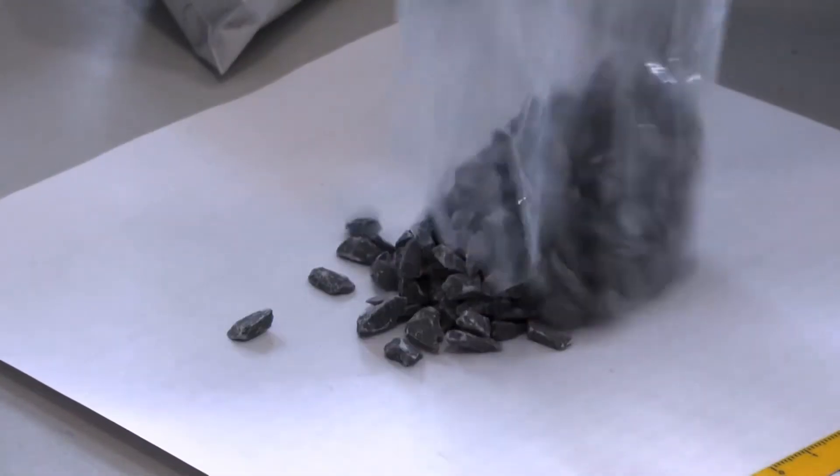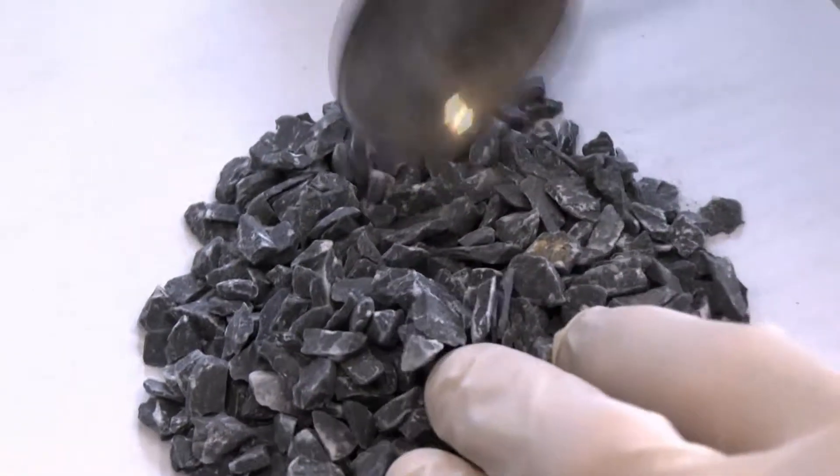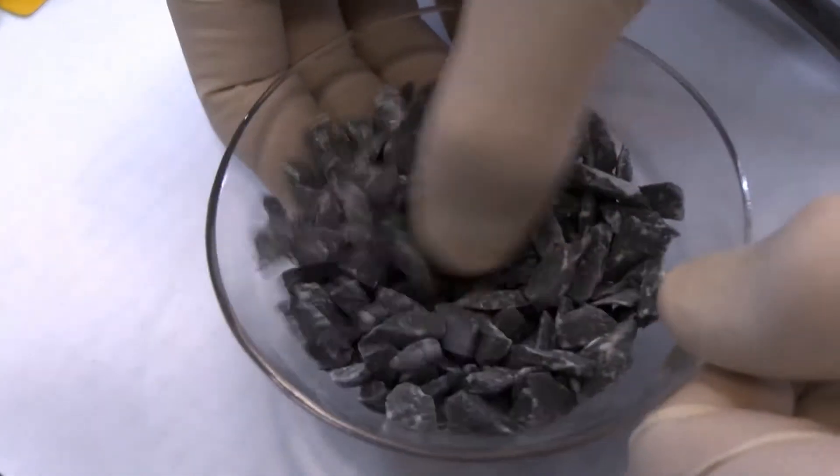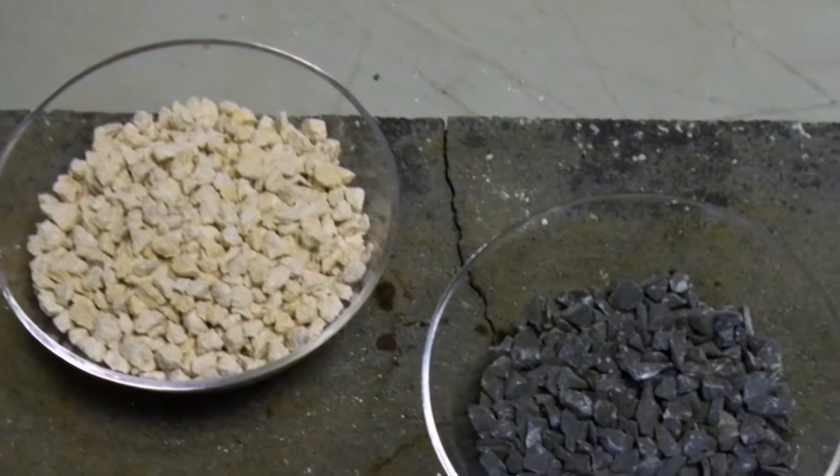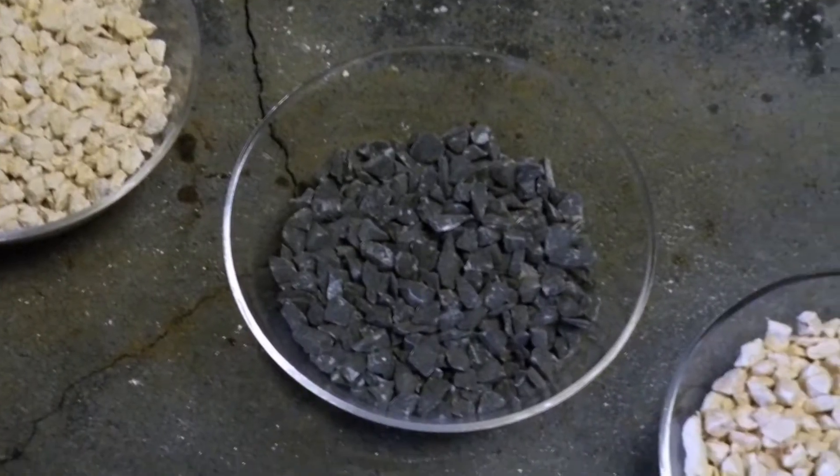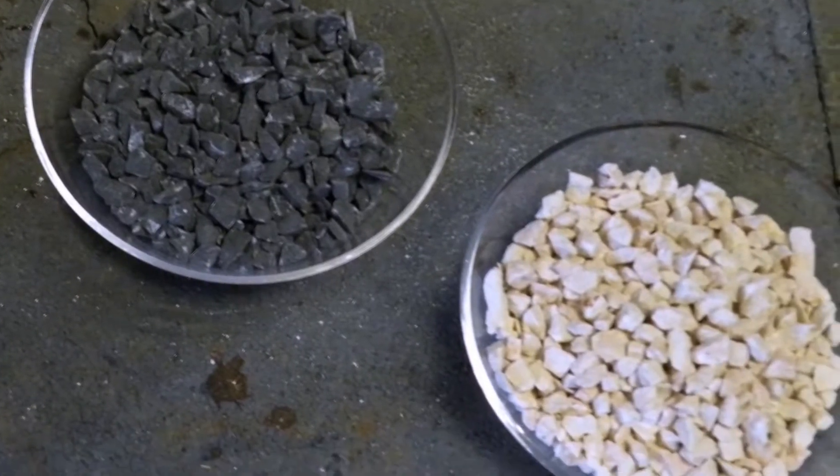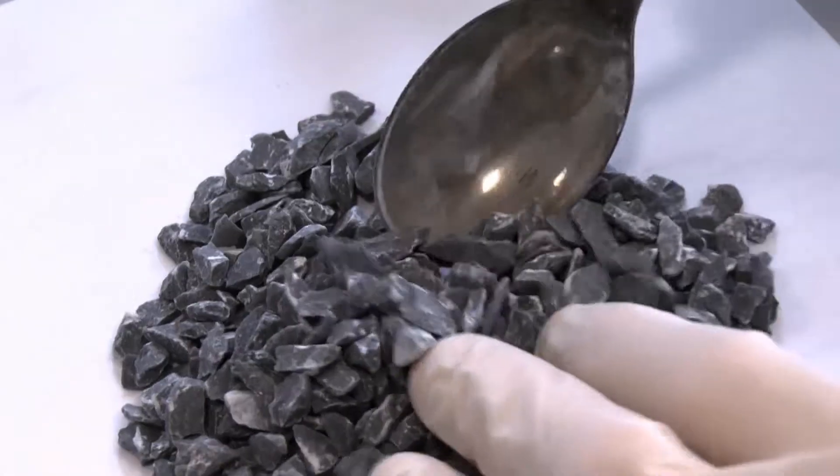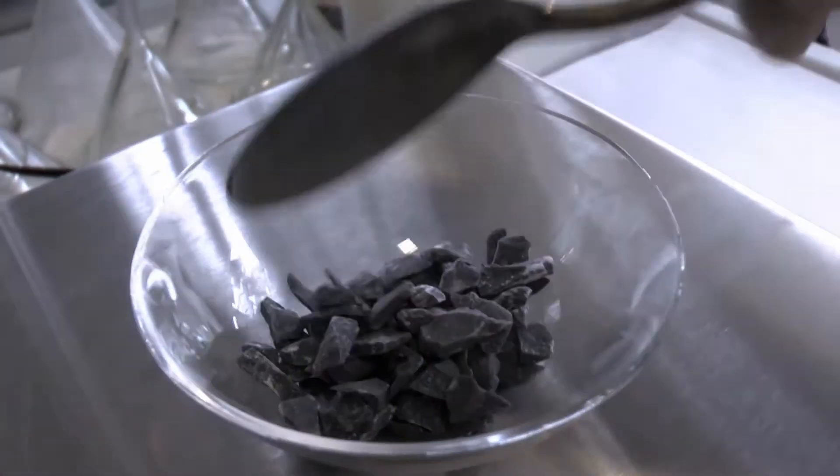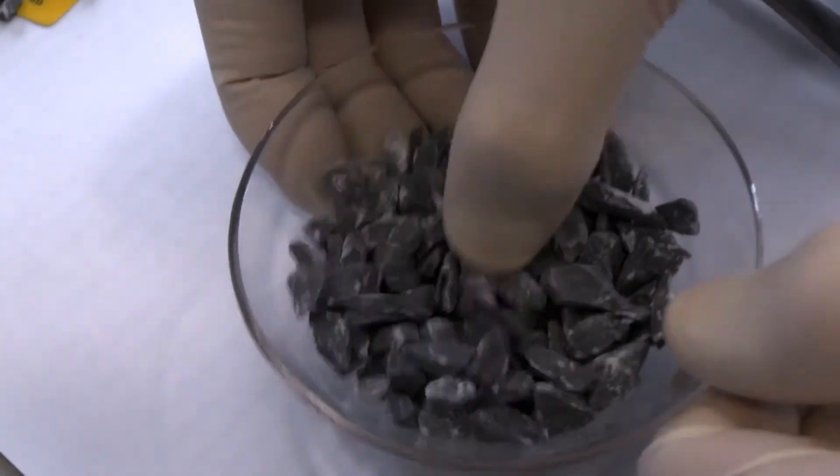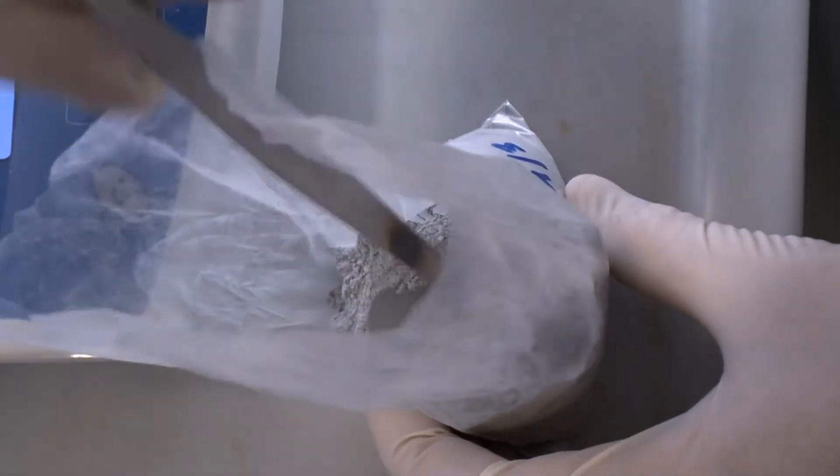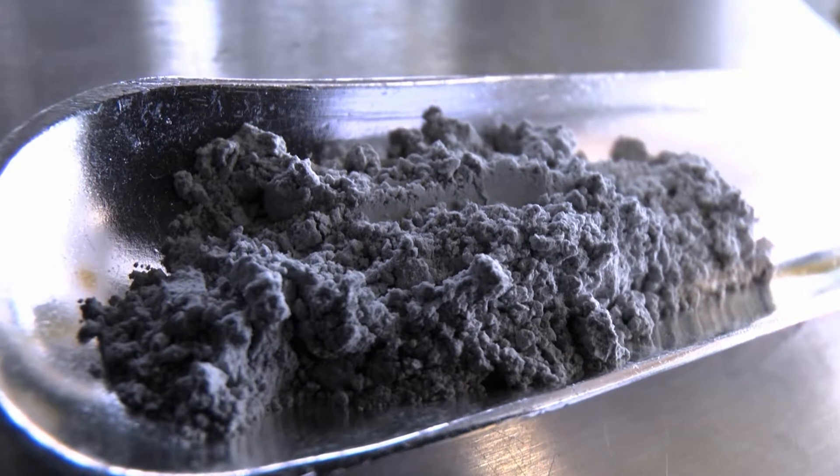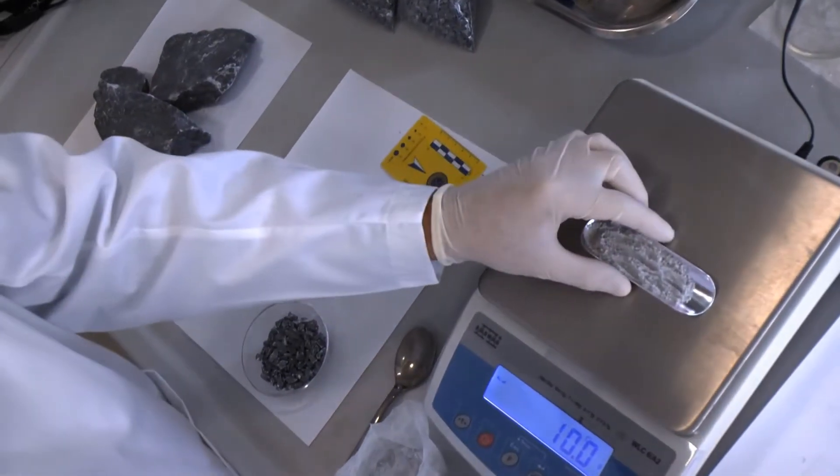Some stones are crushed, and subsequently the granules are brought into contact with powder from the same sample, then calcinated at 1300 degrees centigrade for three hours. The preparation consists in placing three layers into a quartz crucible as follows: one, a bottom layer of 50 grams of stone crushed to between 3.35 and 6.3 millimeters; two, an intermediate layer of 10 grams of powder, less than 63 micrometers.